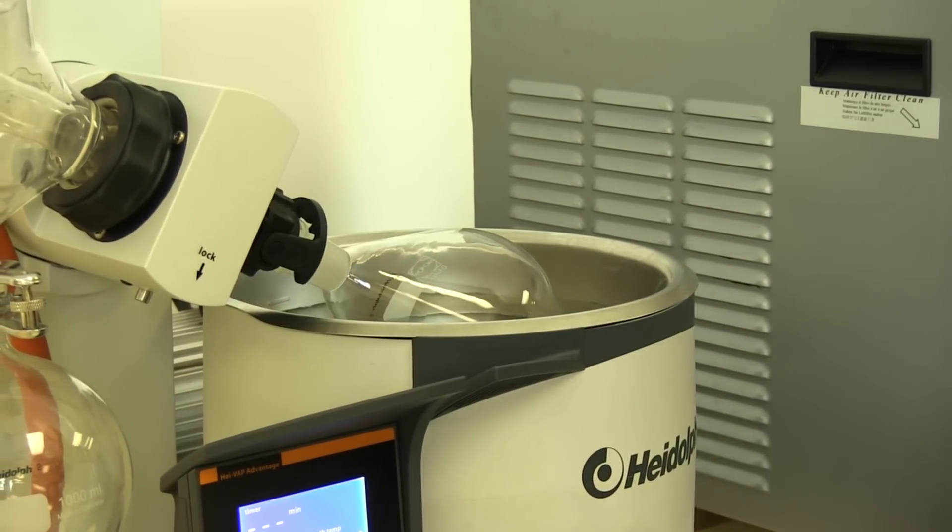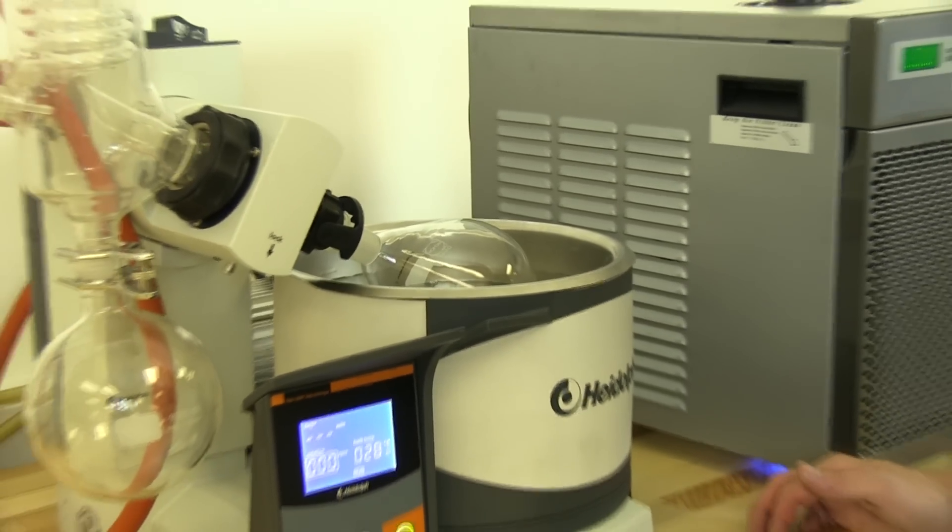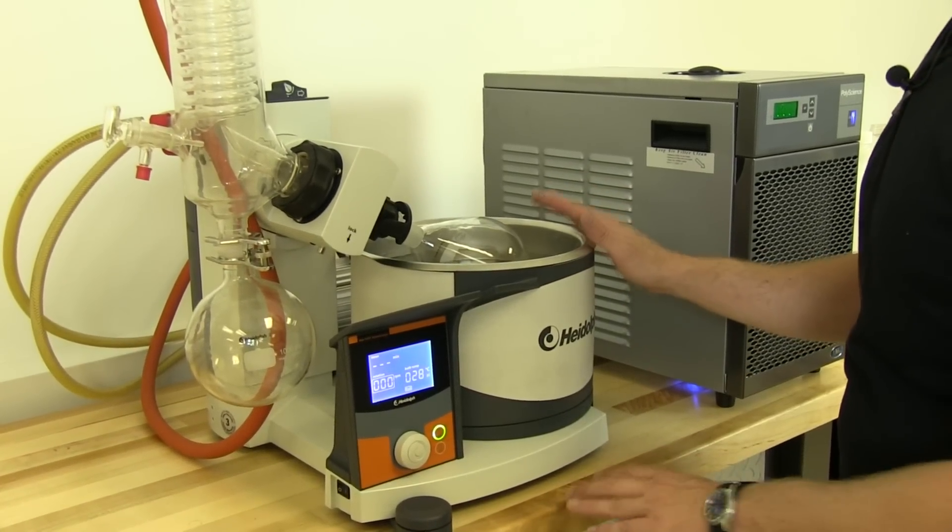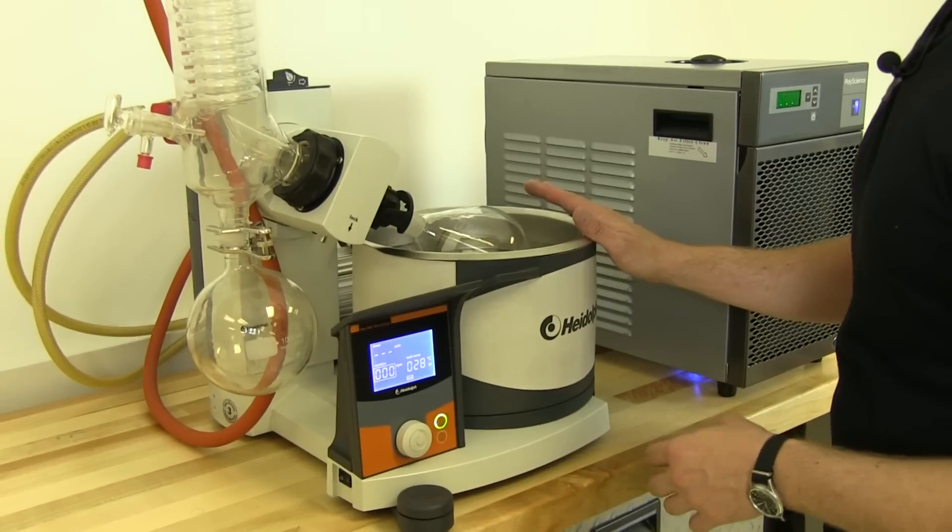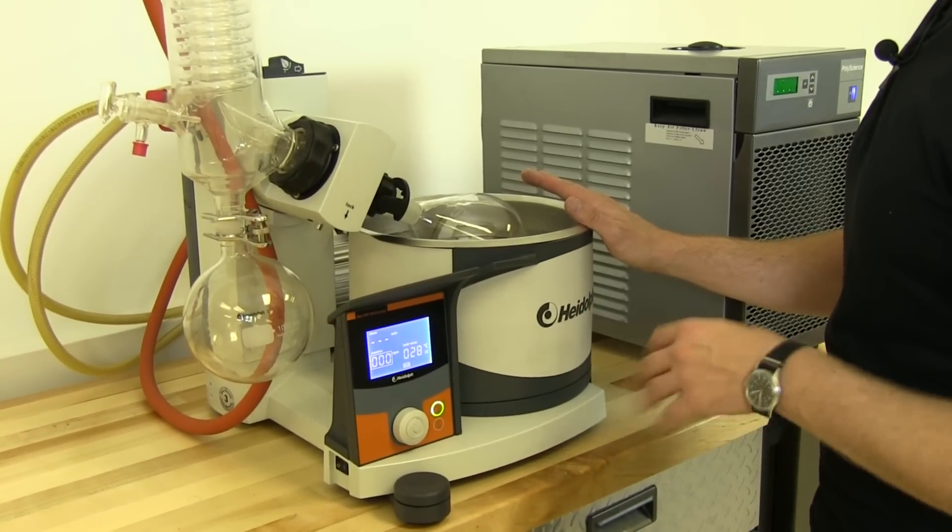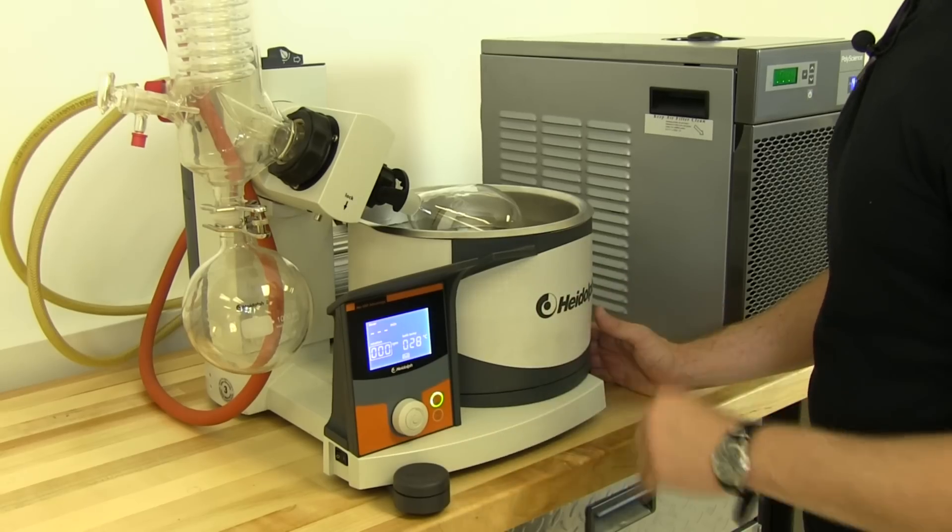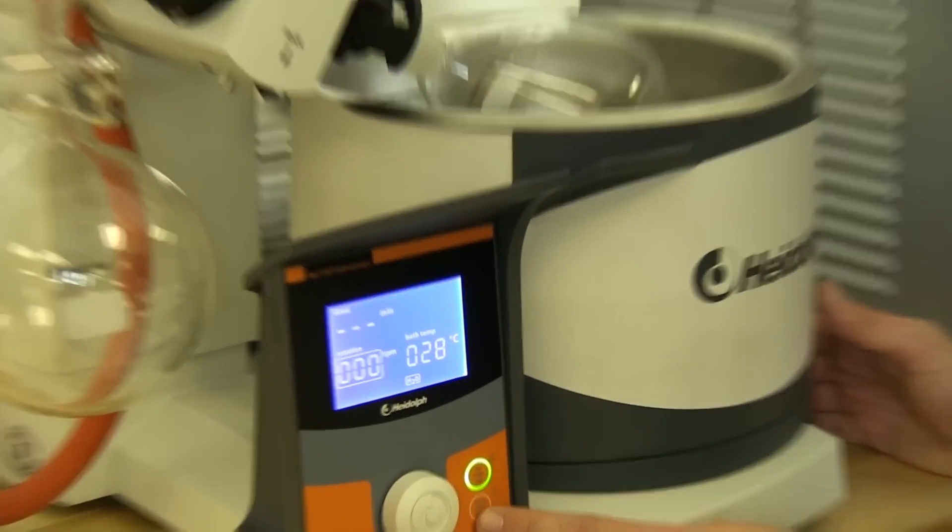We have the heater that we can turn on and off and we can adjust. Really, we can do this at just about room temperature. We can raise it up to maybe 40C and really get this process moving a little bit faster.